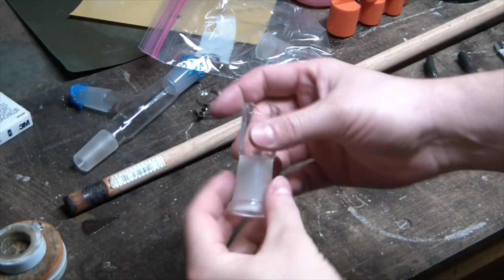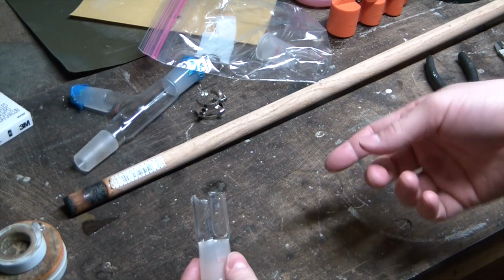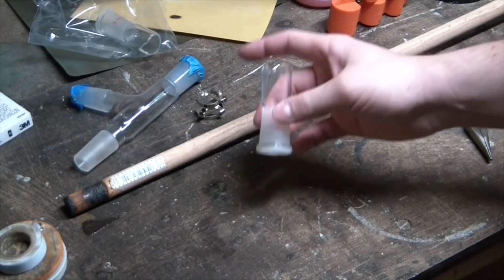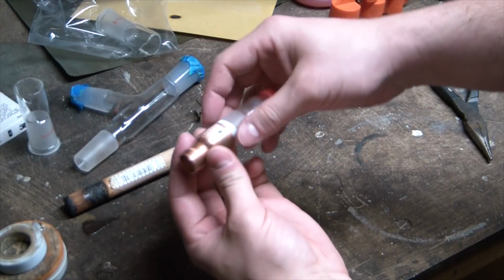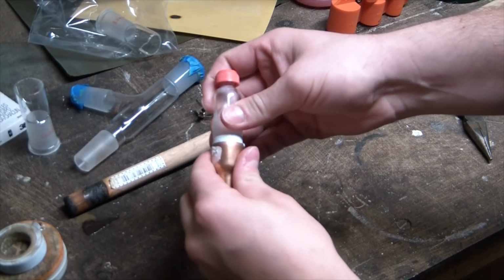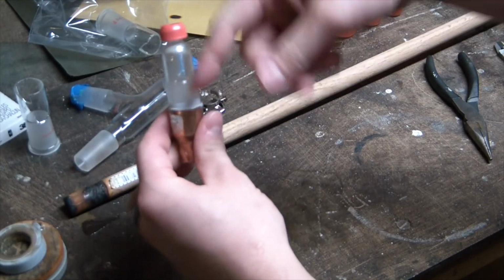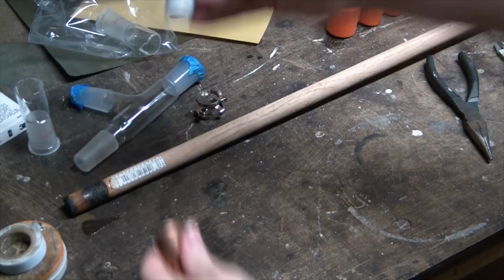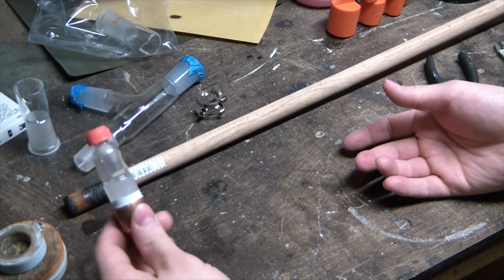Well, disaster struck while I was off camera and I cracked the good piece. So, the bad piece might still be usable, but I think I actually found an easier way to do this. Basically just gonna braze a 3/4 inch fitting on top of the stockpot and put the Vigreux column in just like that with a little PTFE tape around it. Totally airtight and pretty darn easy. So that seems to simplify things significantly.